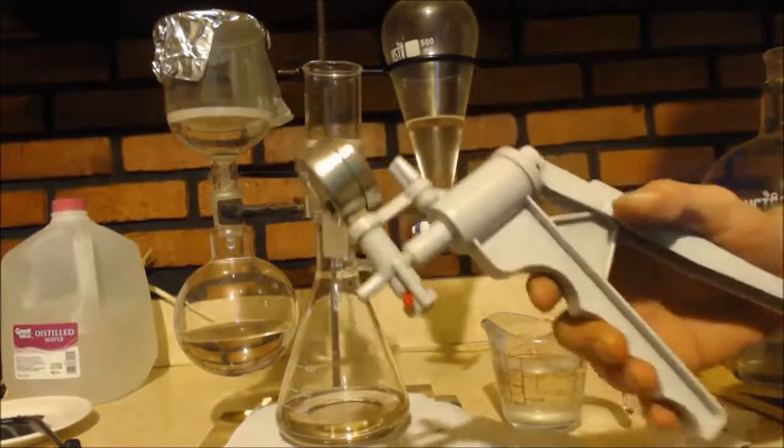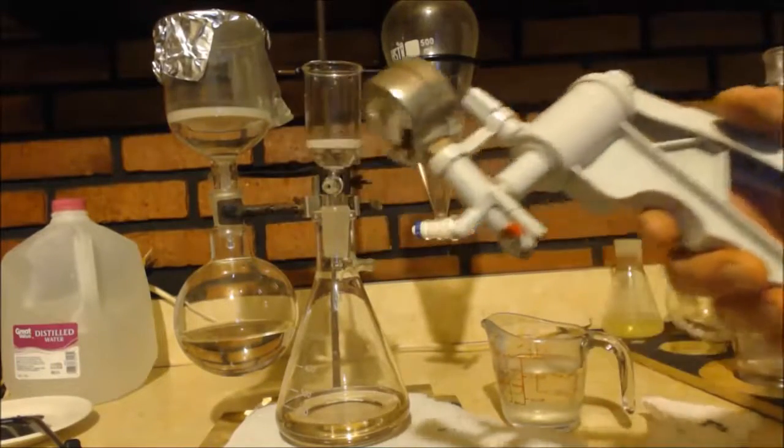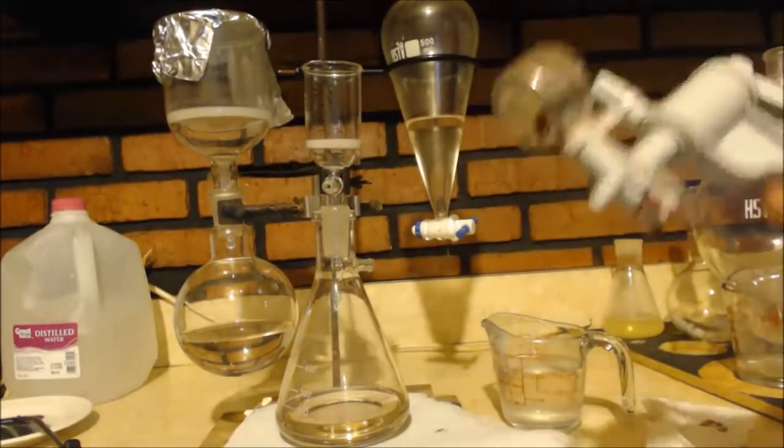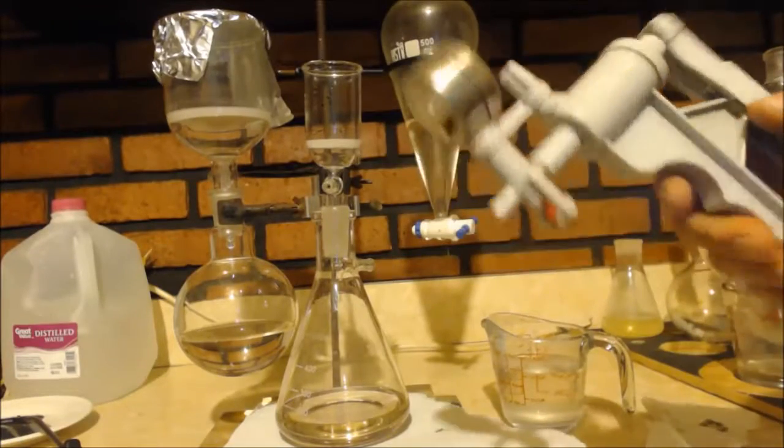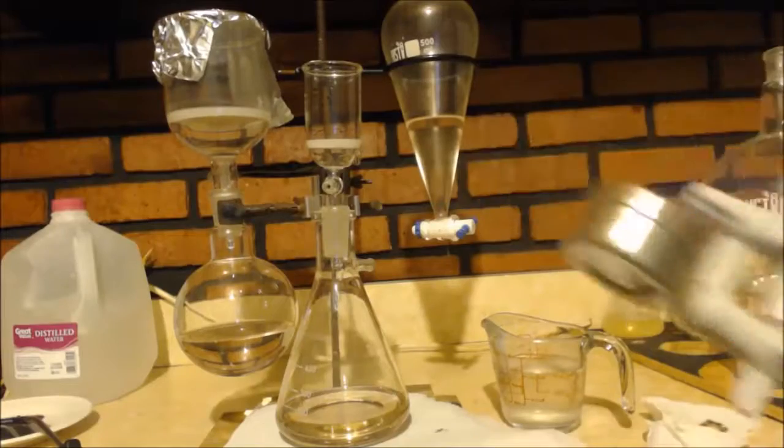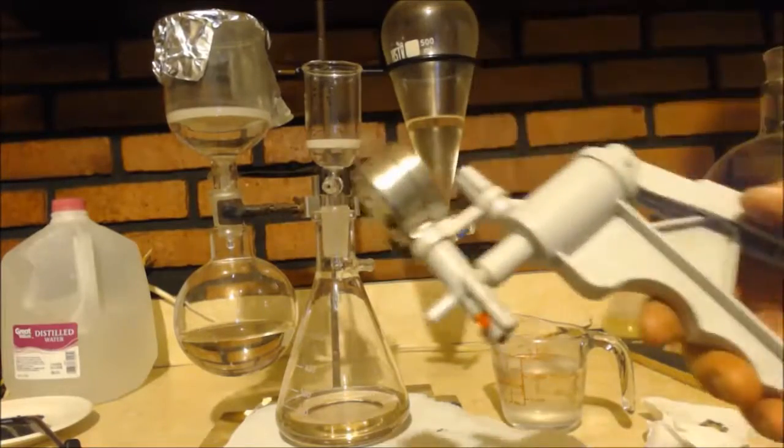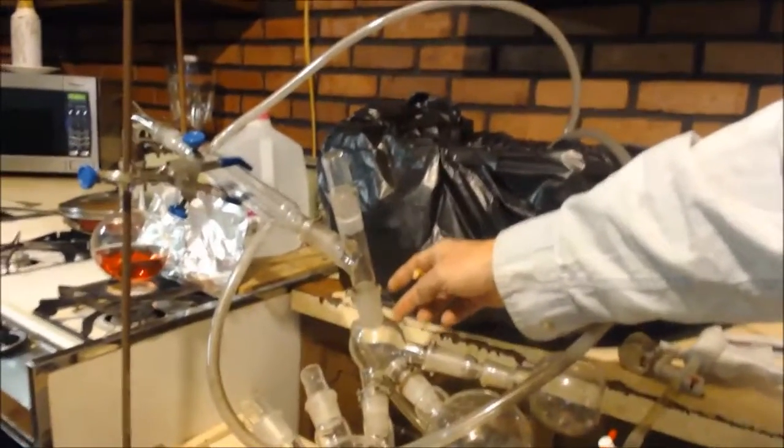Once it starts boiling, it will take, you know, you'll have to pump it every once in a while. Because as it adds gas into the system, you know, that takes away from your vacuum, right? So, I mean, it's no big deal. It's not like you're pumping it every second. Anyways, here's my stuff. I'm going to distill it. Here's my condenser. Now, it comes down into this weird thing here.